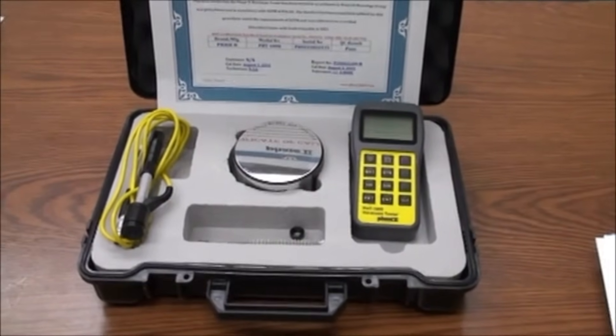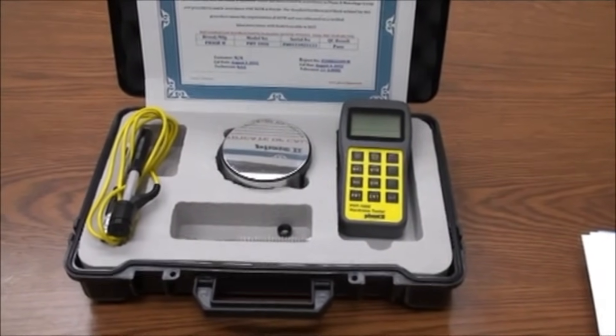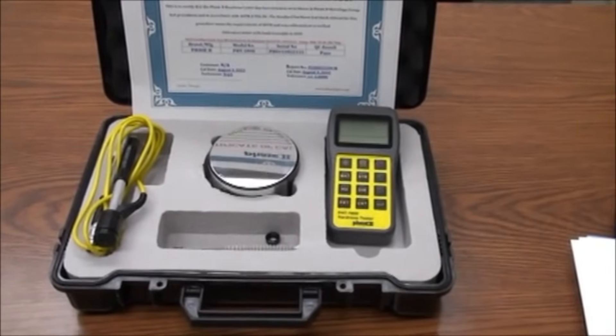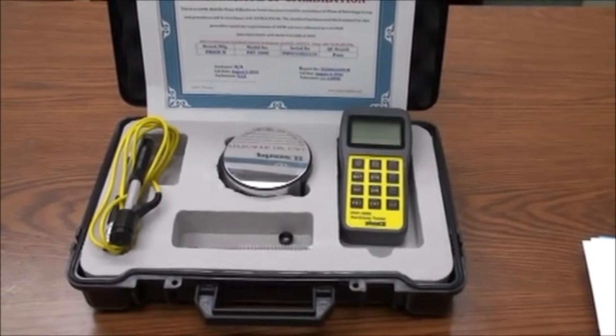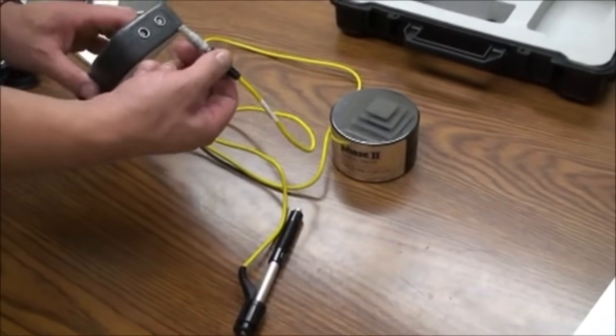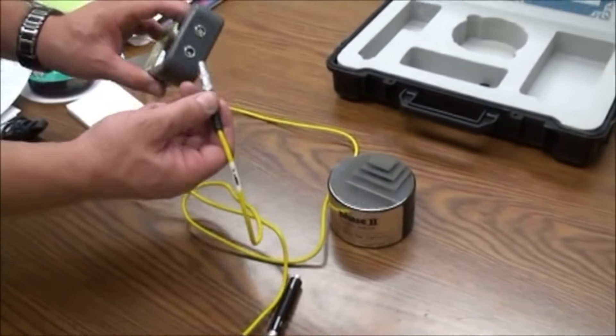Now let's move over to operation of the hardness tester and see how easy it is to utilize the different functions, taking tests and obtaining results. To begin, insert the plug of the impact device into the correct socket on the tester.